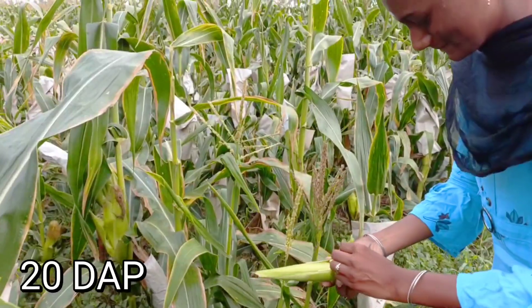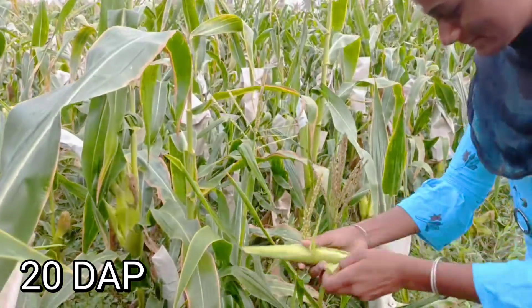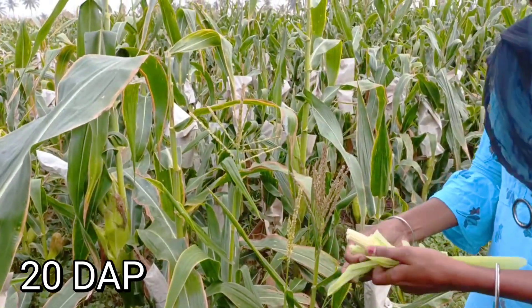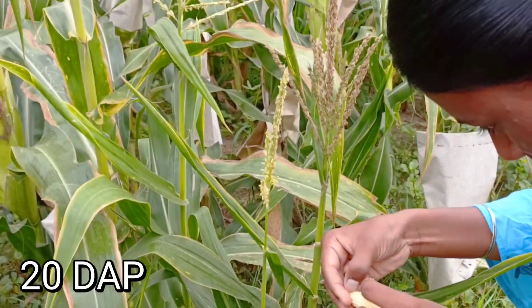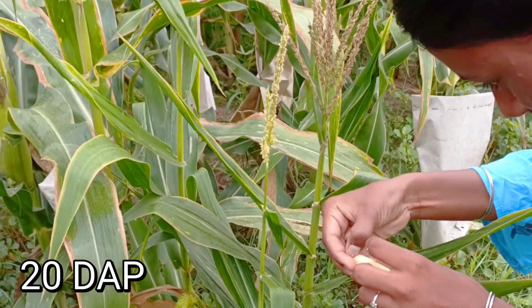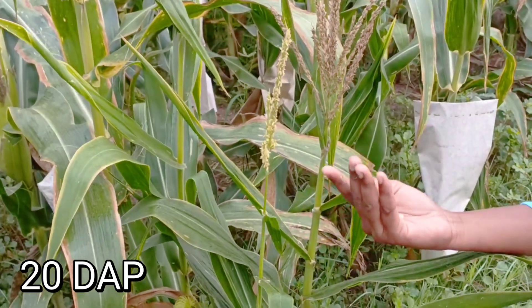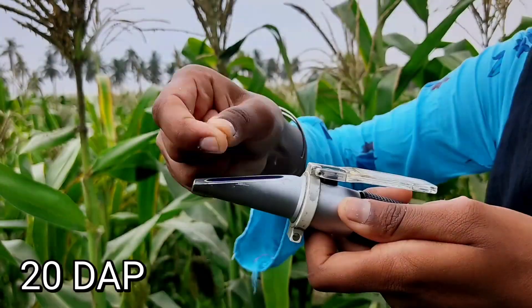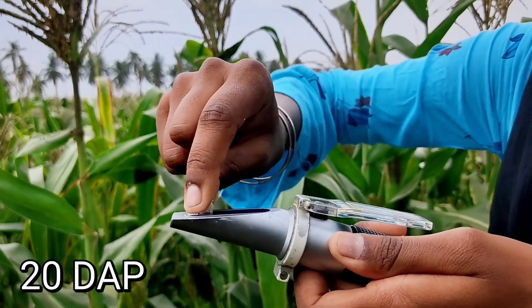This is the 20 days after pollinated cob. The kernels were collected from the cob and pressed with a finger over the prism of the Brix meter, which is kept perpendicular to sunlight. The Brix value is then recorded.